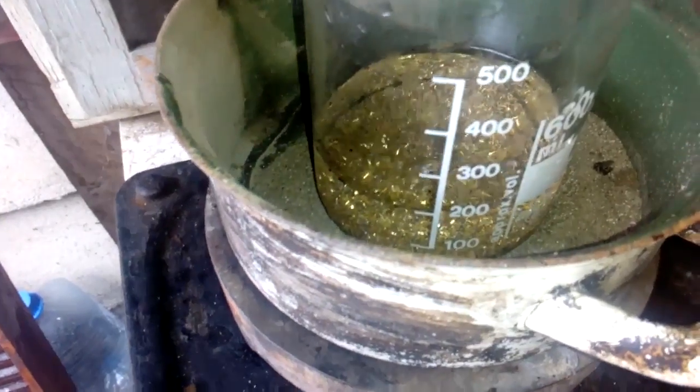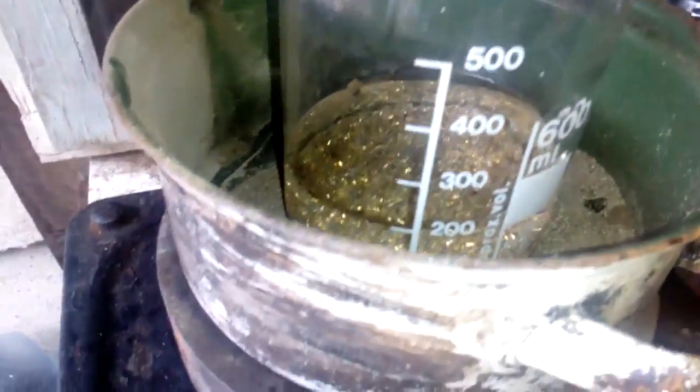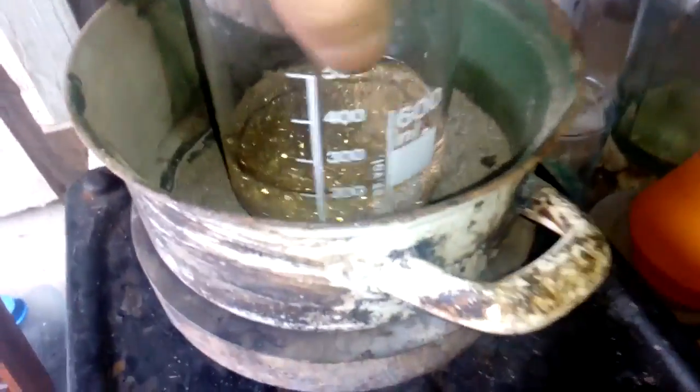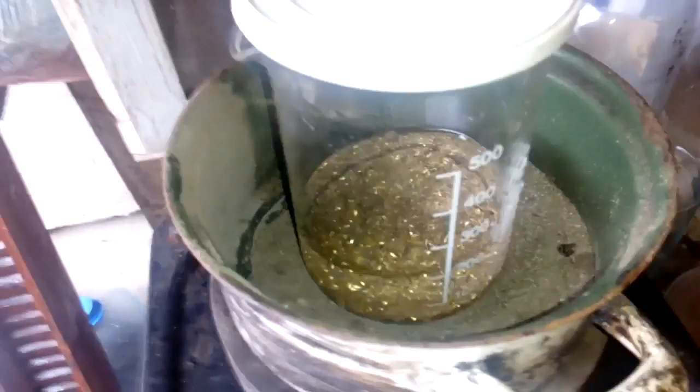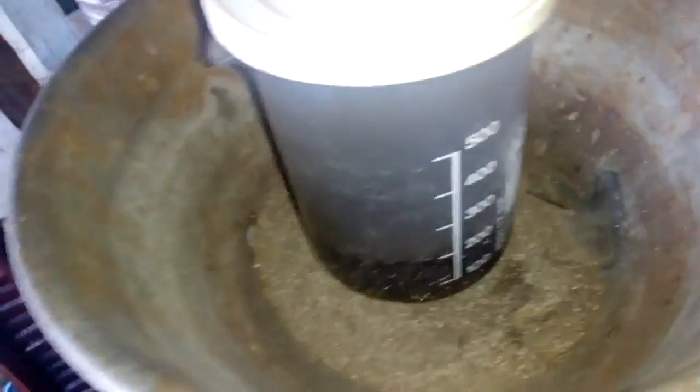Okay, so let's cover that and put some heat on, just low heat, and leave that for maybe 1 hour on a low temperature to remove all that tin and lead. Okay, I'll change this catch pan because I removed some other stuff I do right now.